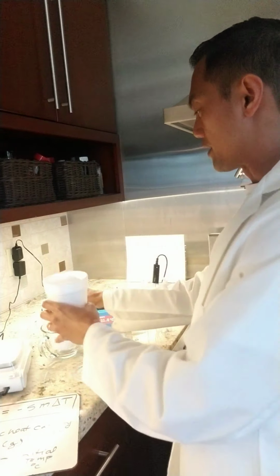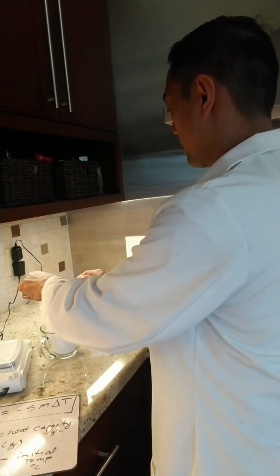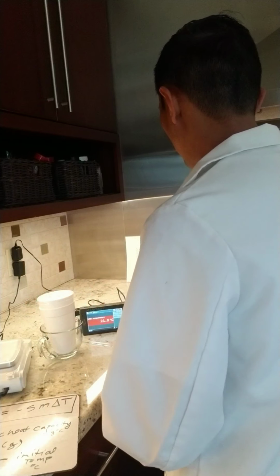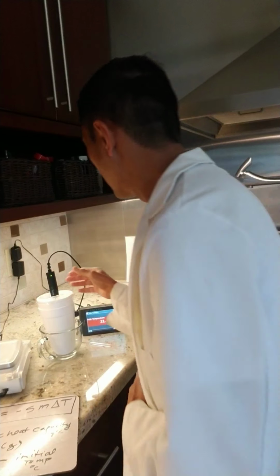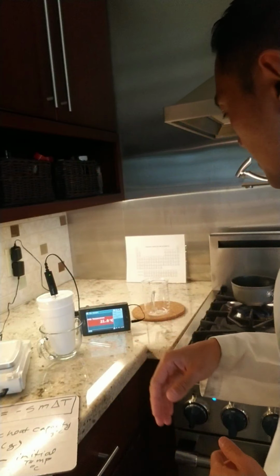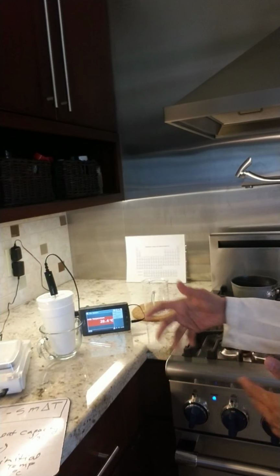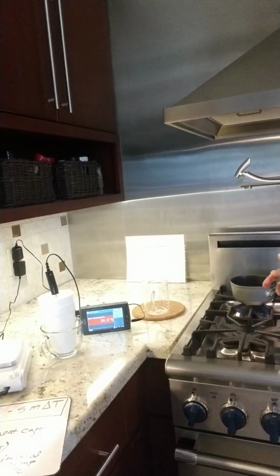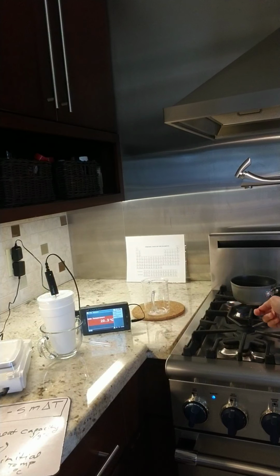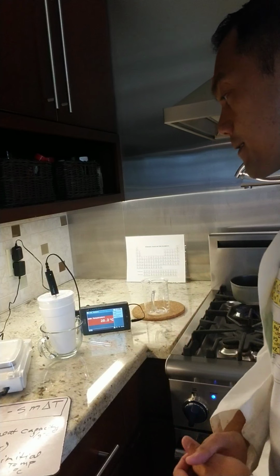We need an insulator again, so a secondary cup. And then measure our initial temperature. Make sure it's touching it. Yep. All right. So while that's measuring the initial temperature, I'll announce it. Keep in mind, this is the second metal that we're testing. I'm currently heating that metal in boiling water to pick up the starting temperature of 100 degrees.